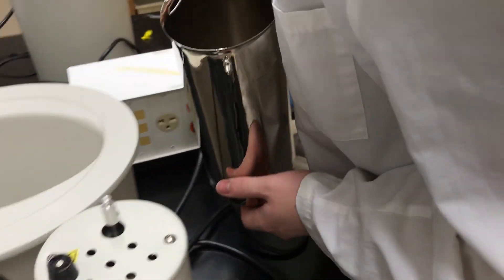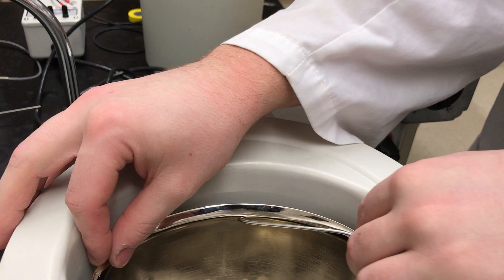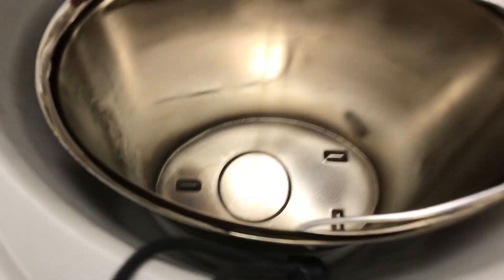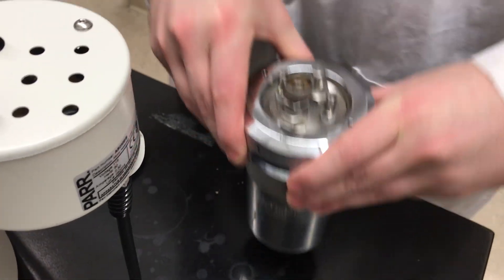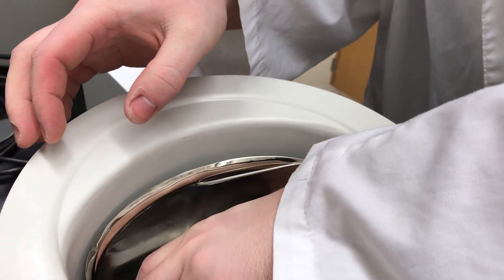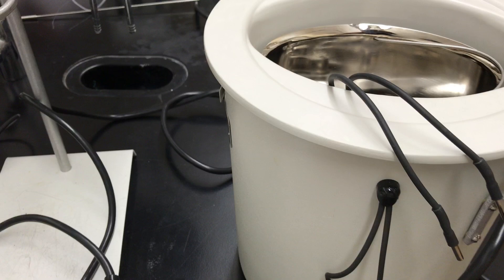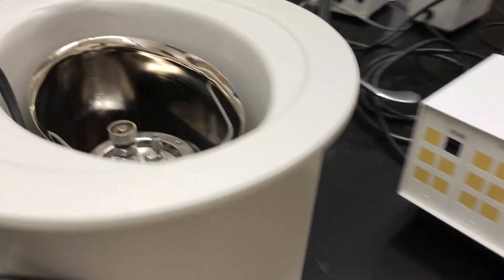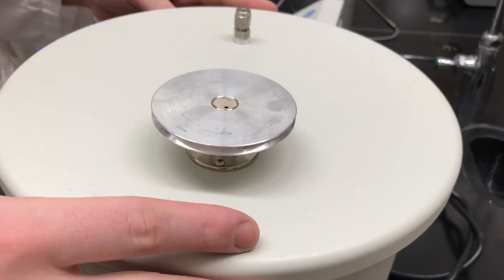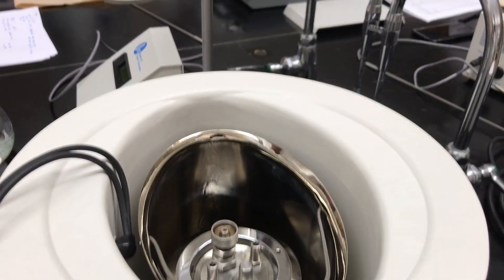Here's the bomb's water reservoir. The bomb is going to fit right there in a little circle. Again, gently lower it in there — your sample is in there. We're checking the stir rod to see if anything was obstructing it. Just give the motor wheel a little spin.